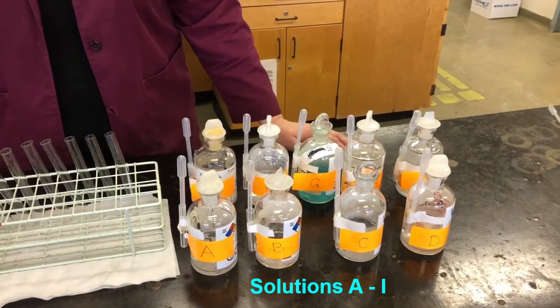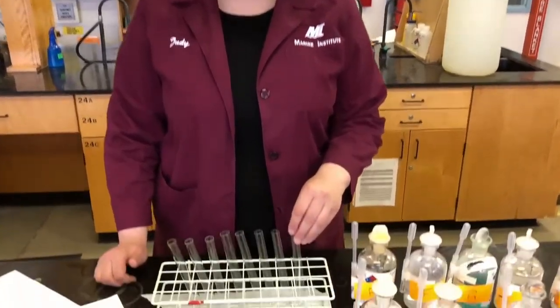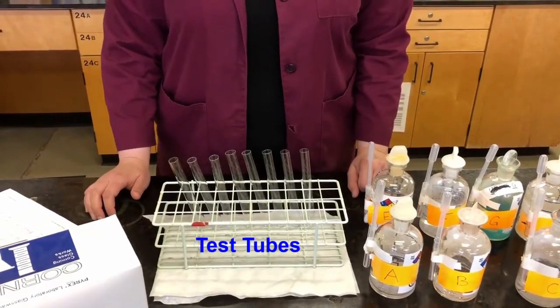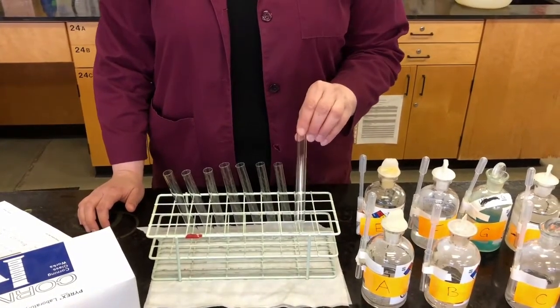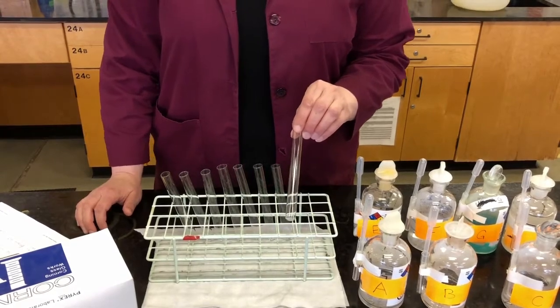As I mentioned in the first video, any time you're working with a solution that is labeled as an unknown, you want to make sure that you treat it as a hazardous substance because we don't know what it is. It's always important to work safely and treat everything as hazardous. We're going to start off by mixing the solutions in test tubes. I have 8 test tubes here for all the different reactions. I'm going to follow along with table 2.2 in your lab manual. I'm going to take 1 test tube for each reaction, and add 1 milliliter of the identified substance to the test tube.